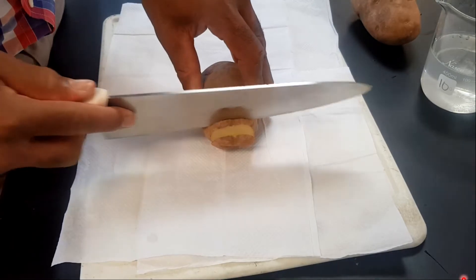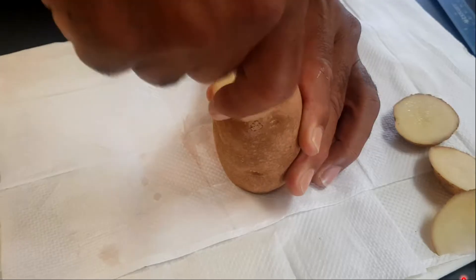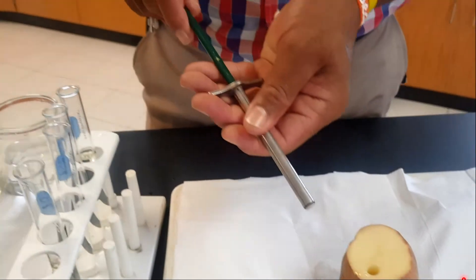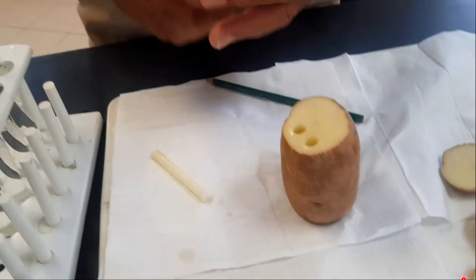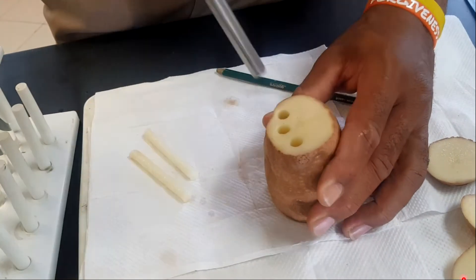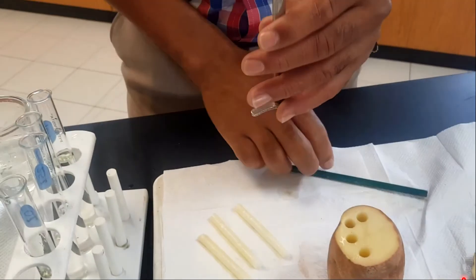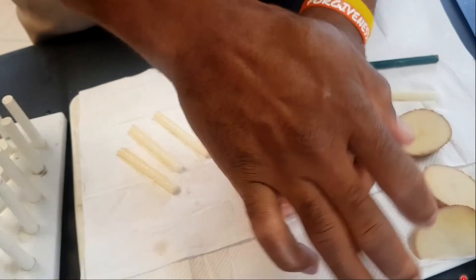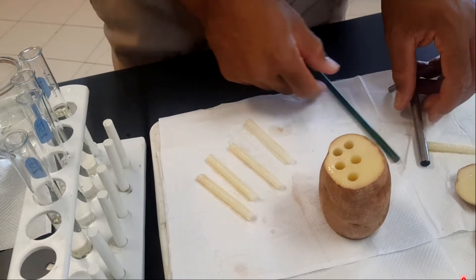Your next step is to cut both ends off the potato so it can stand properly. Then use a cork borer to make strips — push the borer down into the potato and use a pencil with the eraser removed to release the strip from the borer. You need four strips. Don't go close to previous insertions or slant the borer — otherwise the strip will not be good. Keep a nice good distance from previous insertions to get a clean strip.